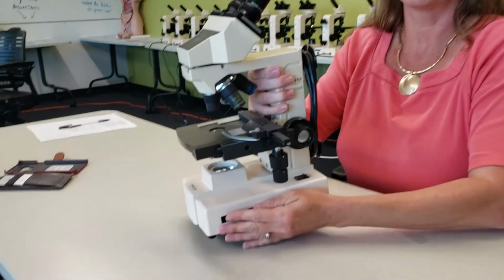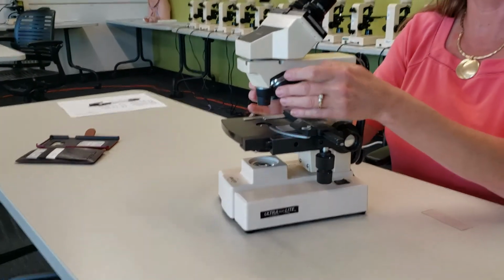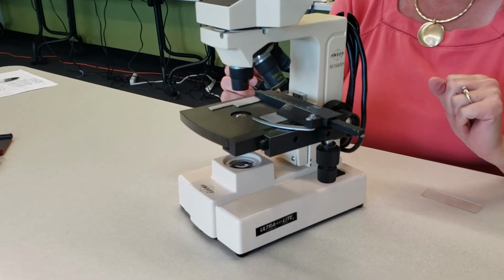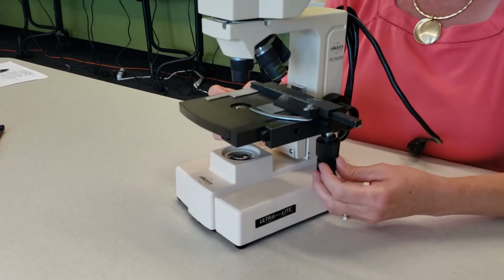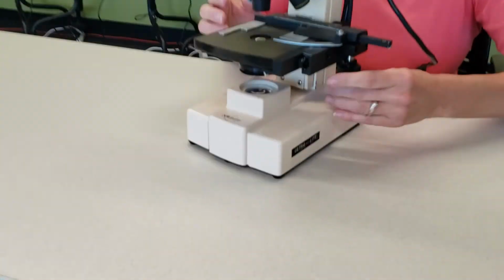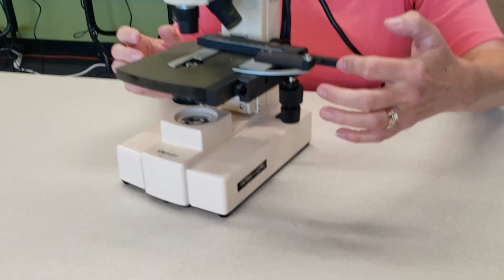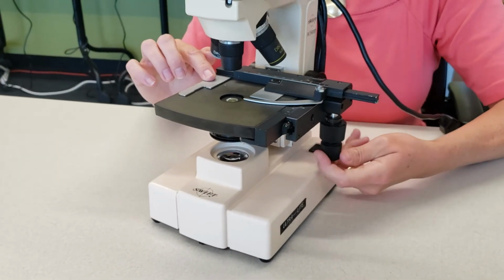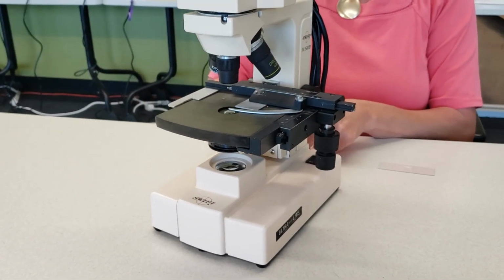And when you put it down, you're going to put it down gently, because if you slam it down hard where you're hearing a lot of vibrations, you can knock the lenses loose in the inside, which can damage your microscope. One thing I forgot to tell you before you put it up is to make sure your mechanical stage is centered, because if it's not centered, you can easily ram this into the cabinet and damage the scope. So again, you want to make sure that this mechanical stage is centered so that there's less chance of you ramming or pulling a part off of the microscope.